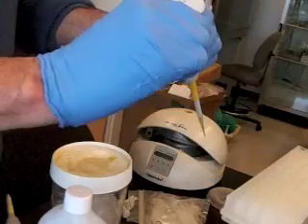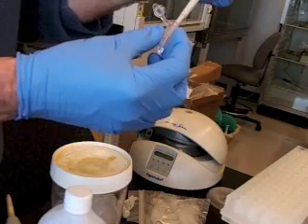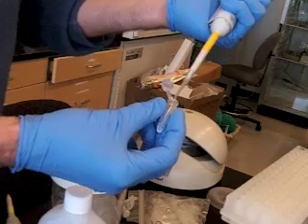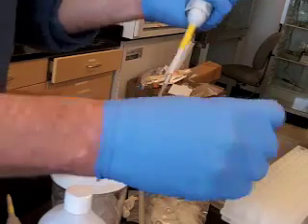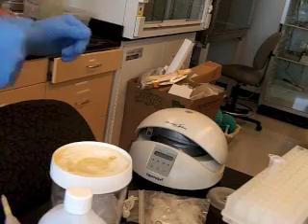I'm going to uncap this, bend the cap out of the way, and then I'm going to look at this and watch as I put the tip into the liquid and eject the liquid, and then I'll plunge it up and down repeatedly and rinse it out, and then I'll use the final push to get everything out of there, and I've mixed my small volume in with my big volume. That's really good.